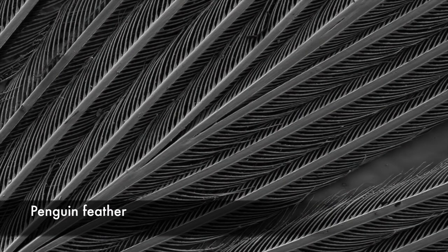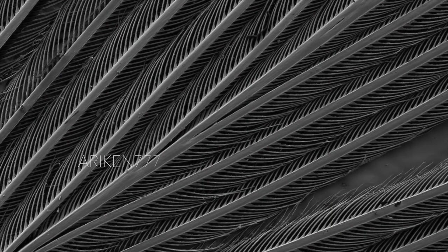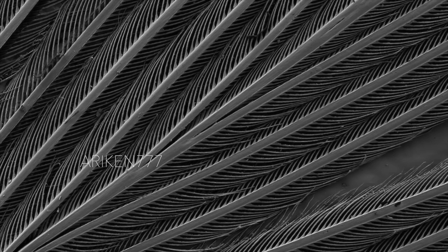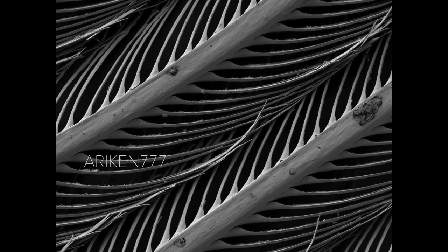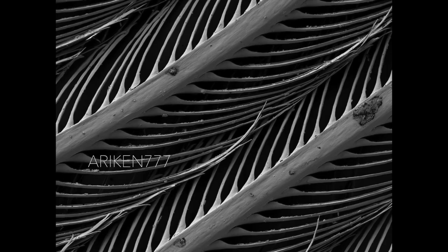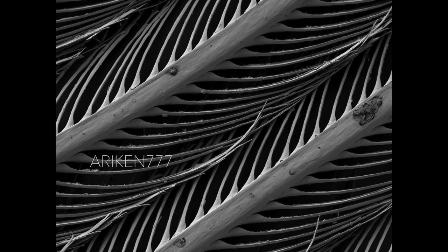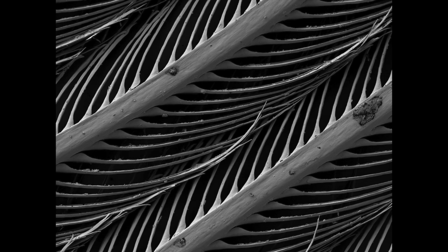Outer feather of a penguin. Penguin feathers are short, overlapping and densely packed. The outer part of the feather is waterproof while the inner down section traps an insulating layer of air, keeping the penguin warm in sometimes freezing water.